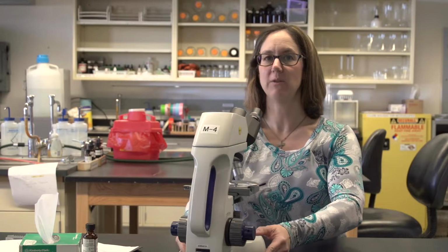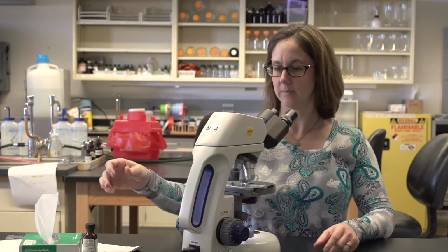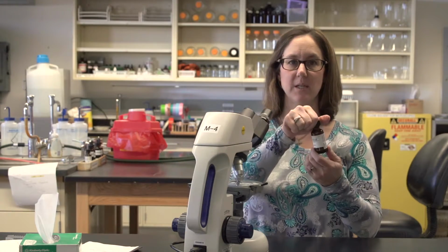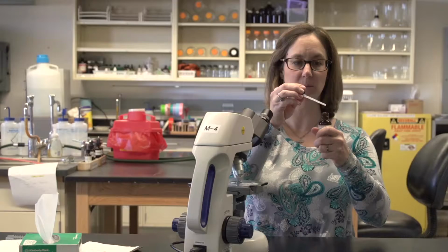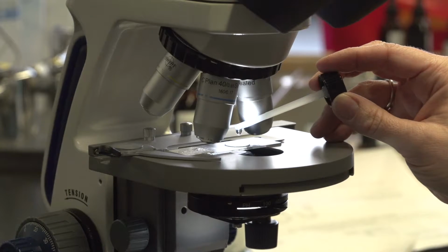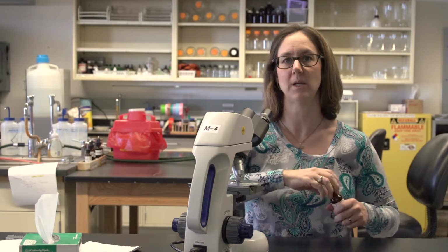To refract the light into the microscope lens, you need to put oil onto the slide before going up to the 100x objective. If we are in focus at the 40x objective, we will then move halfway between the 40x and the 100x objective. You will take the immersion oil, and 1 drop of the immersion oil will be put onto the slide. Try not to get oil anywhere else onto the scope. In addition, try not to touch the slide with the applicator, as we do not want to contaminate the oil.